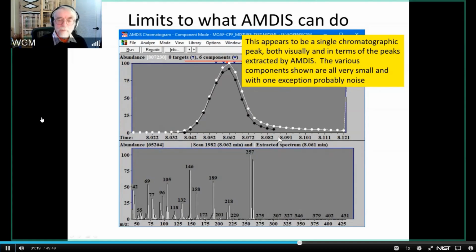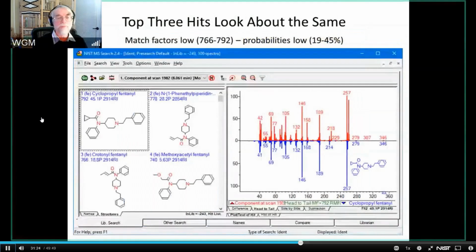And when I send that to the NIST database, what I get, and by the way, in reference to something that Ed said earlier, I'm actually not using the current NIST database to do this search because it doesn't happen to have the compound I need in it. But this is a series of new compounds that we've added to it, and as I think Ed mentioned, these are fentanyls, and there's something like 200-some fentanyls being added.